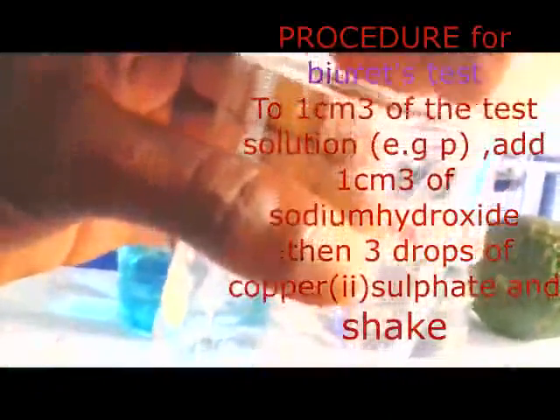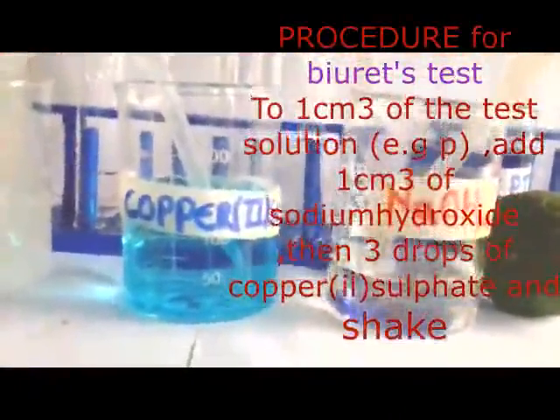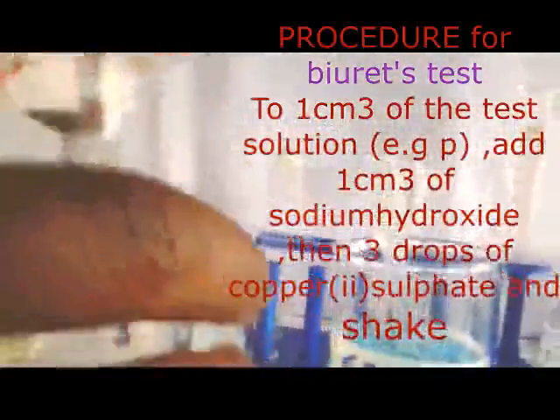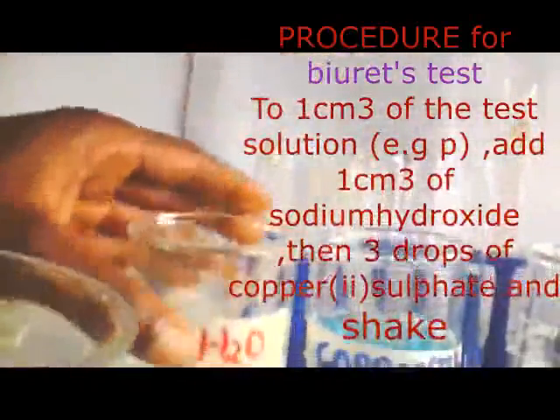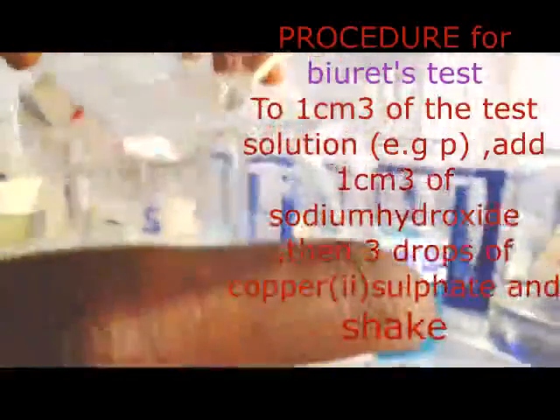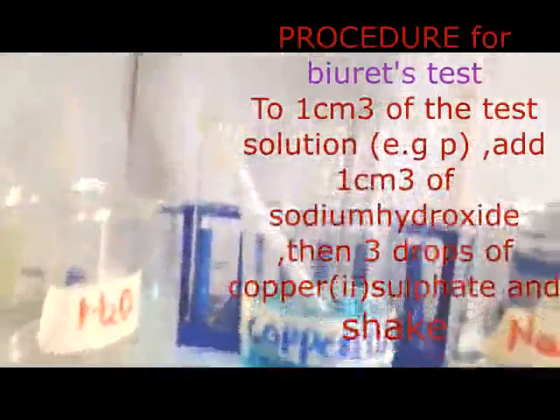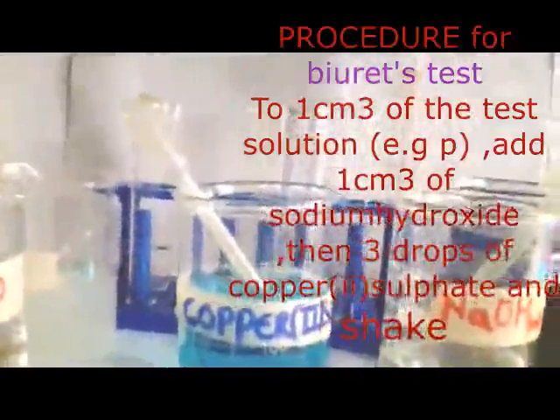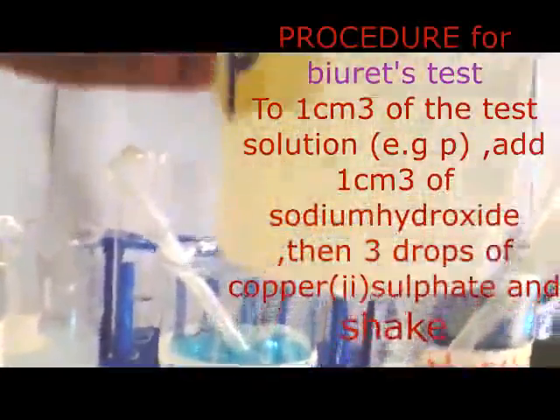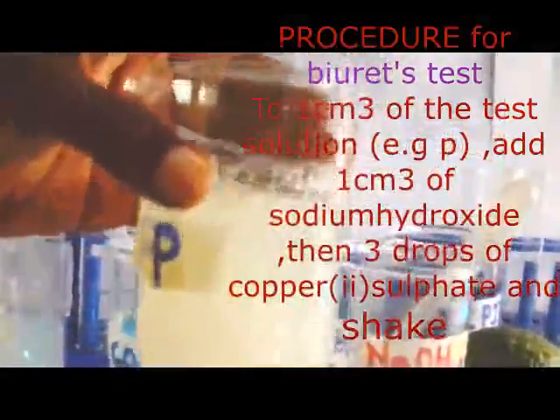Now I get my solution from my egg like that. Then I'm going to add water. I add some water there, as you are going to see. Then afterwards, we are going to do what? Stir. So as we are stirring our solution, we are going to discover that our solution we have obtained is like that.